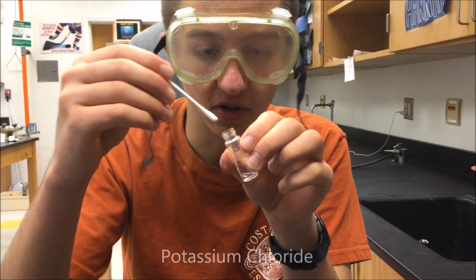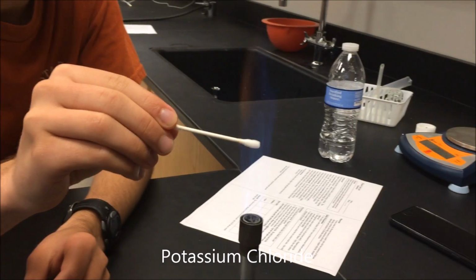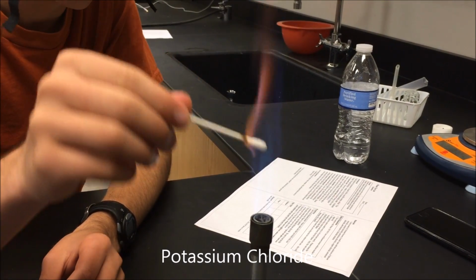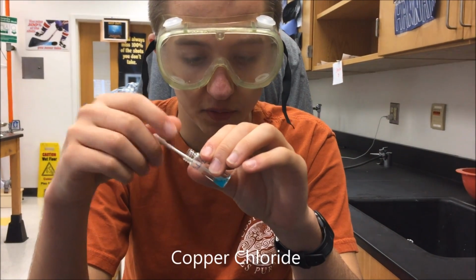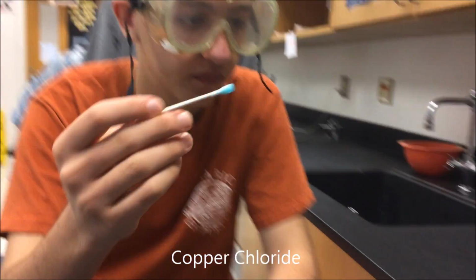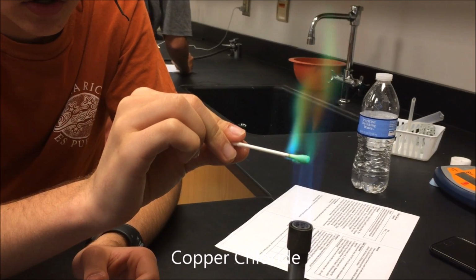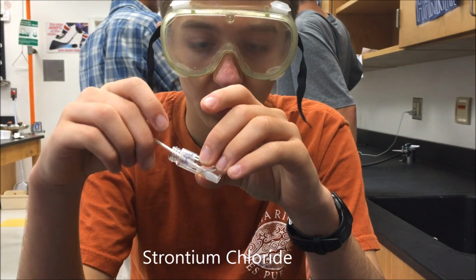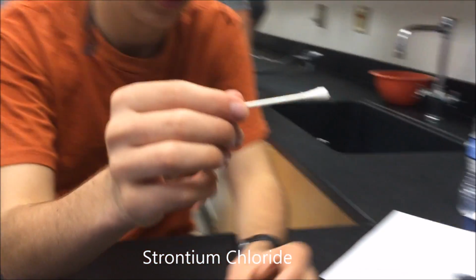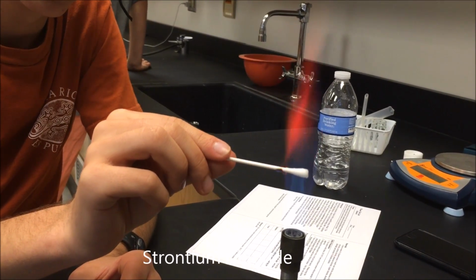The third solution is potassium chloride. Make sure to wet the Q-tip. And over the flame, it produces a nice violet color. The fourth solution is copper chloride. Again, repeat the same process of wetting the Q-tip and placing it over the flame. Copper burns a nice green color. The fifth solution is strontium chloride. Strontium chloride burns a deep red color, red-orange.